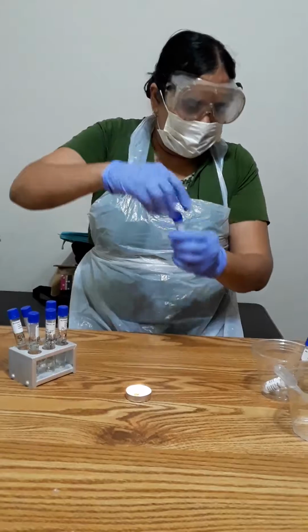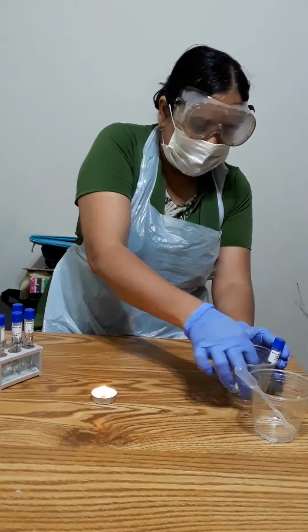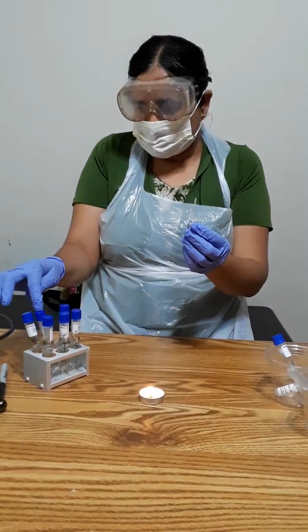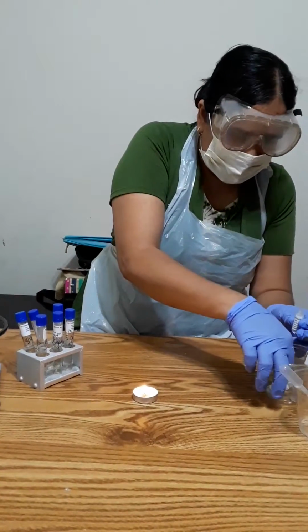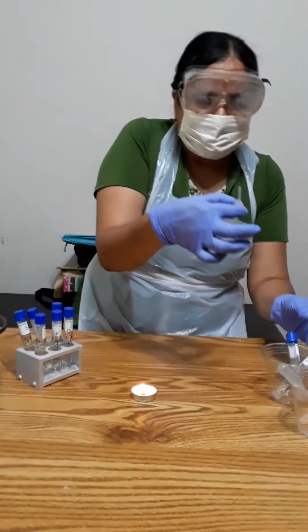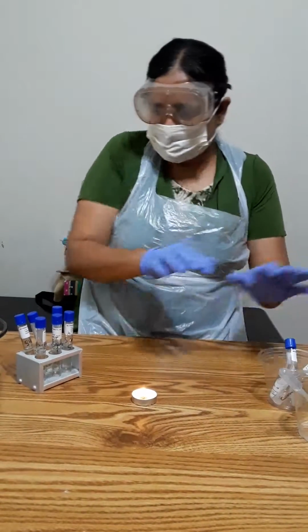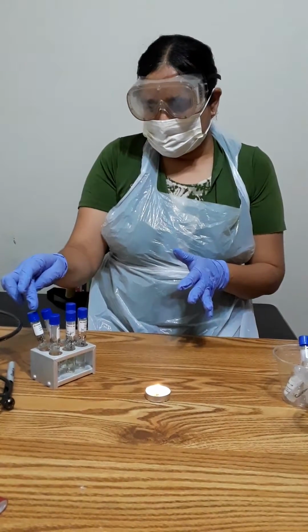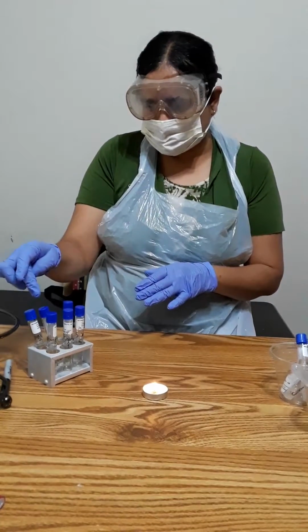So in the same way I'm going to do with S. epidermidis, and the same procedure with tube 9 for both the microbes, and I'm going to put 1 drop of this NaOH solution in it. So this way I'm going to incubate, and in these tubes I'm not going to put anything except the culture, 2 drops here. So each has 2 drops of active culture.